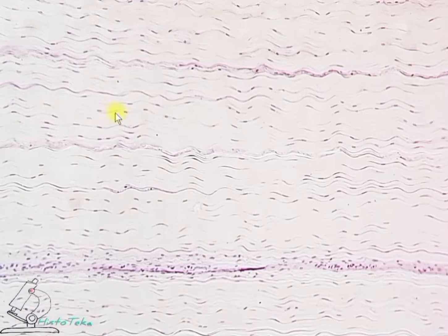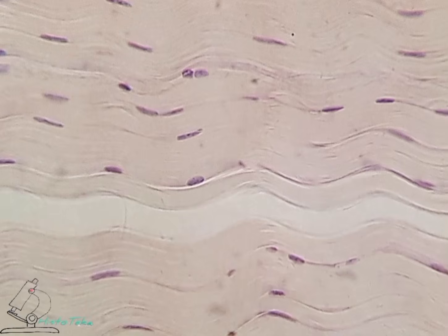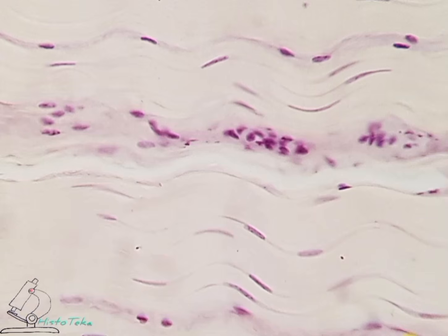Intercellular matrix is made of ground substance and fibers. But the intercellular matrix of this tissue is dominated by fibers. That means there is very little ground substance. That's why the tissue is called dense. Regular means that the fibers in the intercellular matrix are assembled into bundles, and inside the bundles are organized in an orderly manner, parallel to each other and unidirectionally.